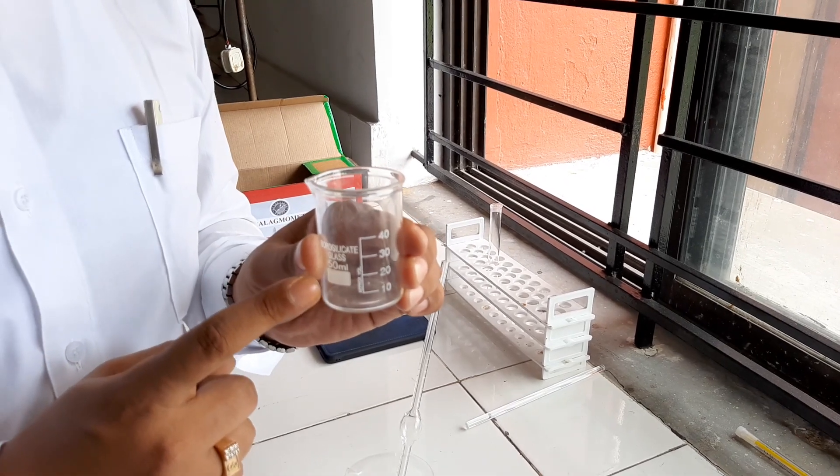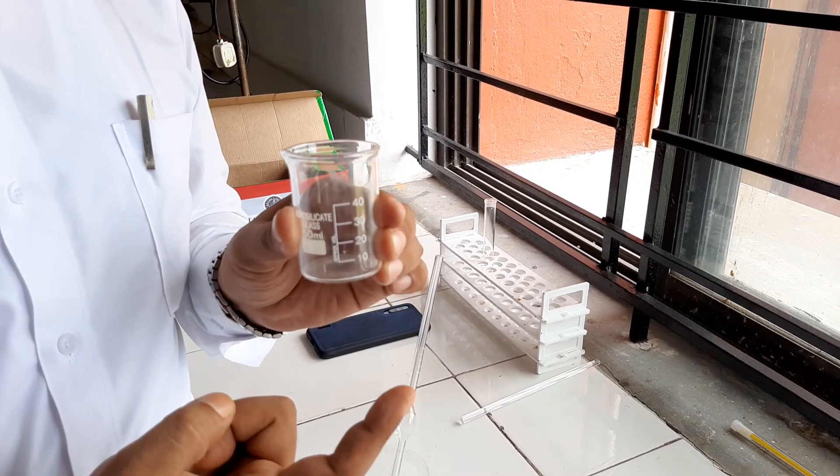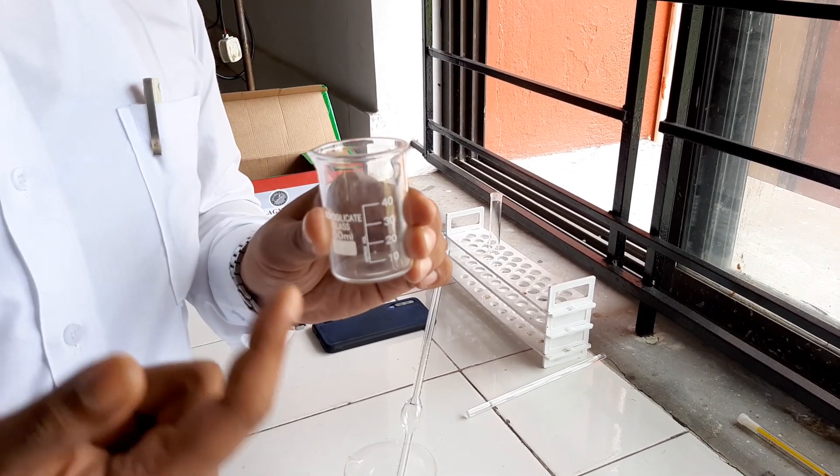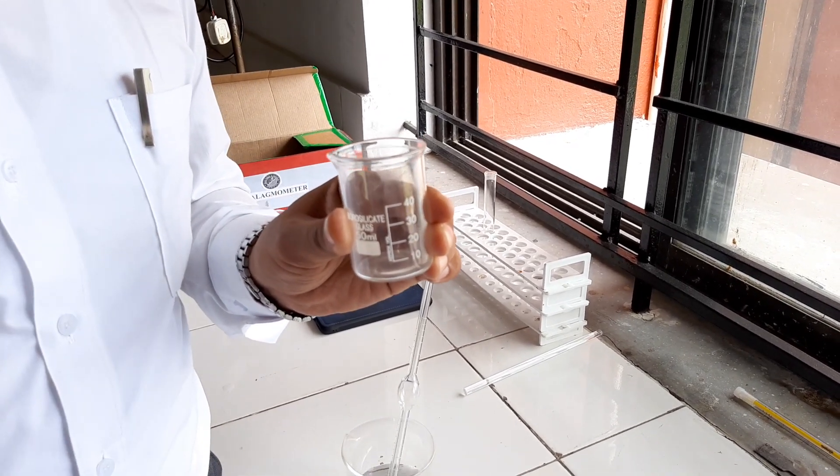So, first you have to take the weight of the liquid, that means distilled water. And after that, in the same way, you have to take the weight of reference liquid.